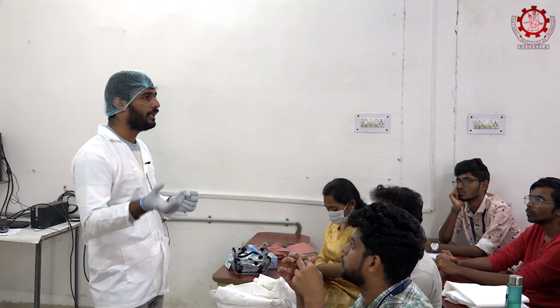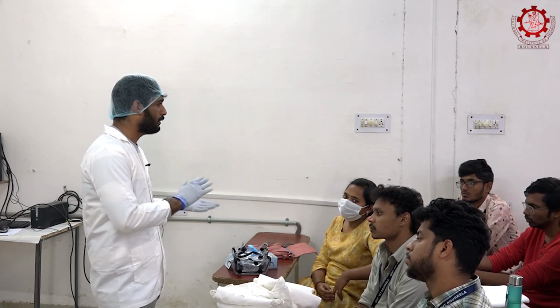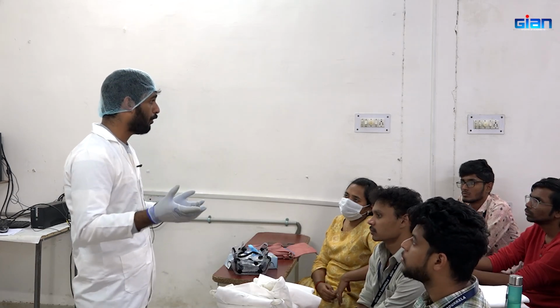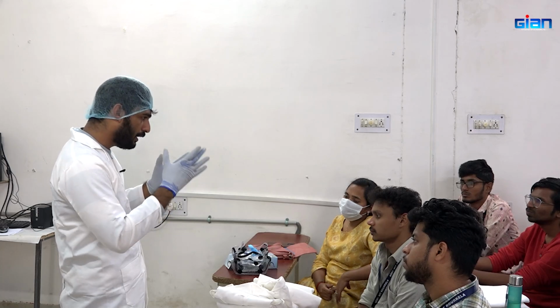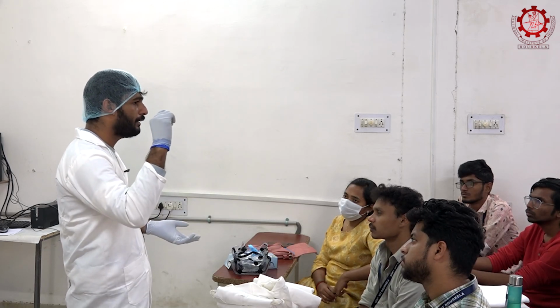and we can go for other characterization. Okay, and the protein characterization also we can do if we are getting enough fraction of protein. It will be solubilized with the NaOH, and the NaOH fraction will be there. So the sodium hydroxide also needs to be removed. For that we have to wash it again and again. We can do isoelectric precipitation. We will be adding acid slowly, and once the fragments dissolved precipitate down, they can be centrifuged and we will be getting the protein fraction.